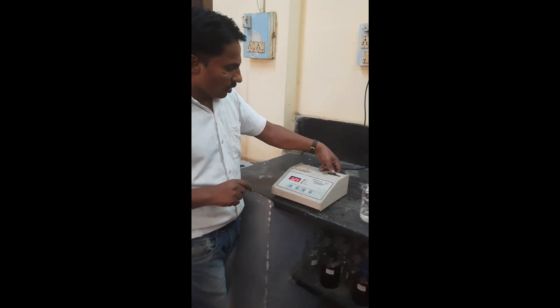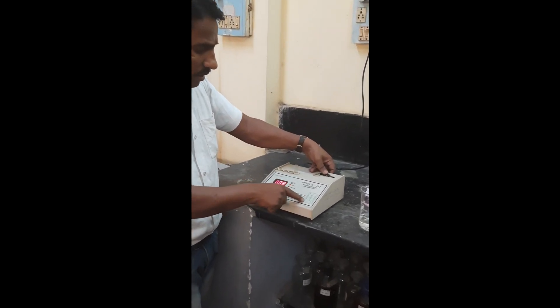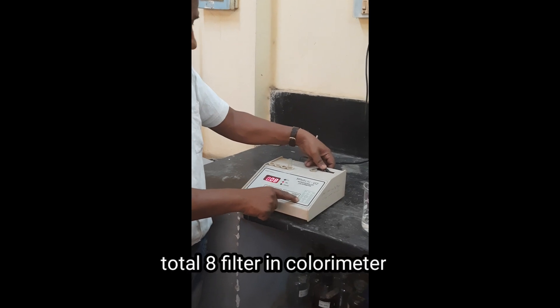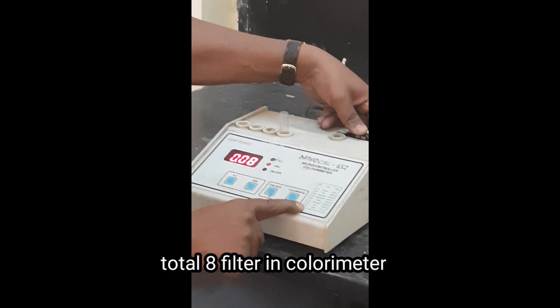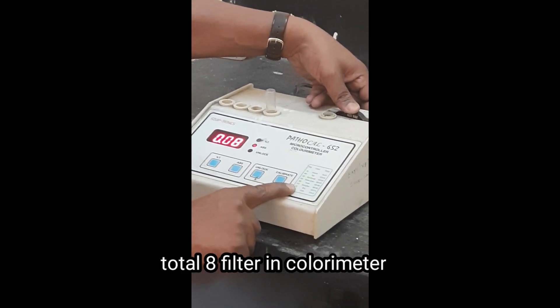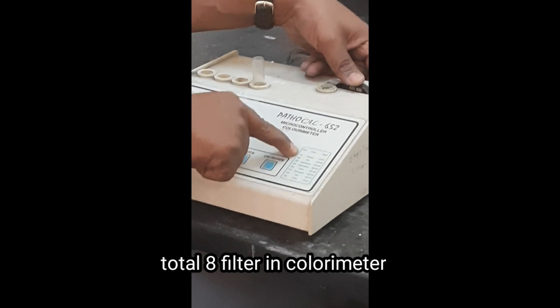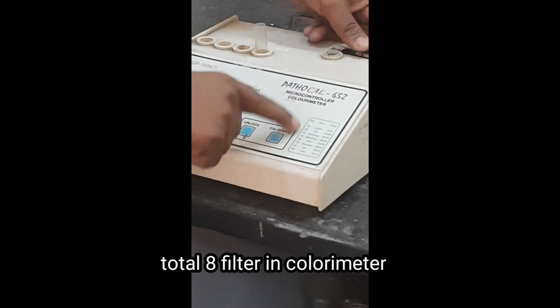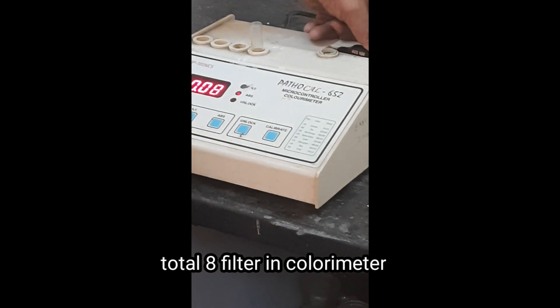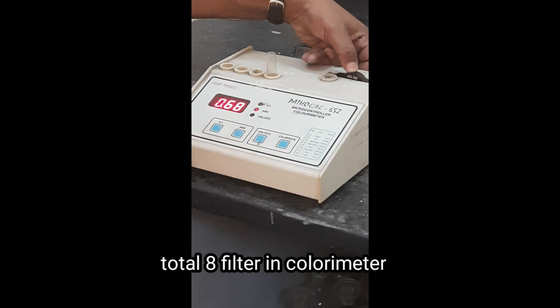Using this knob, there are a total of 8 filter positions ranging from 400 nanometers to 700 nanometers. Different filter knobs are available. The first knob corresponds to 400 nanometers.